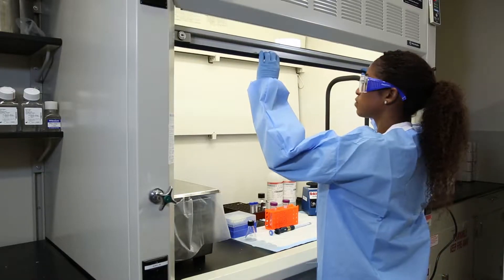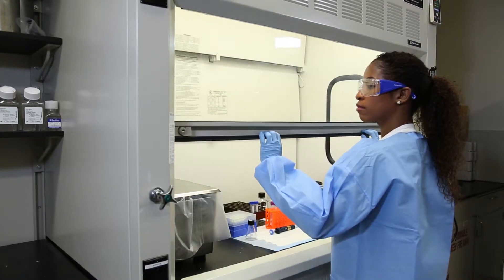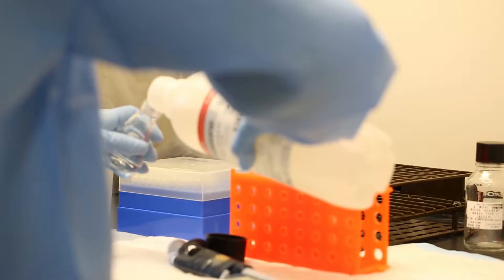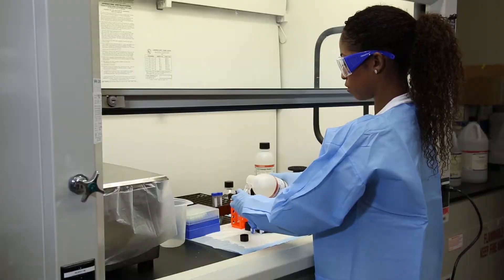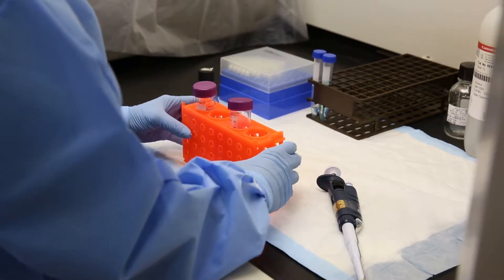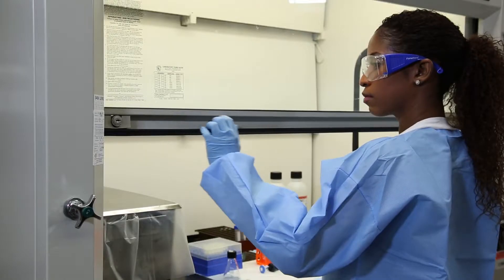Sash height is important for maintaining proper air flow and to keep those working in it and around it safe. When working in the hood, the sash should be at the certification mark.